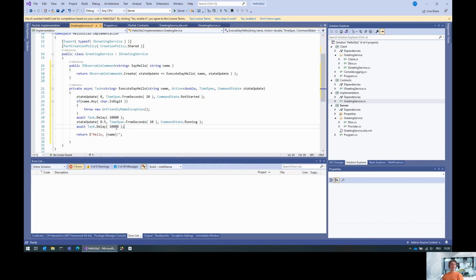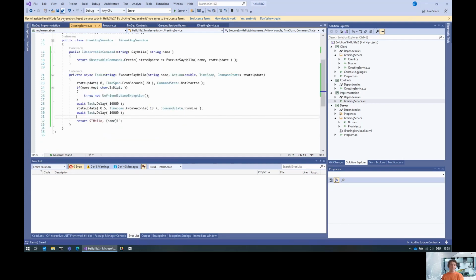Cool. The very first state update is actually not necessary because the SDK will automatically report that we are starting now. And the last is especially not important because once this task completes, the SDK will automatically report to the client that we are completed, so we don't have to tell it, because this is rather obvious. Okay.